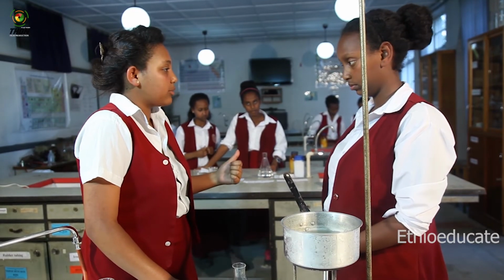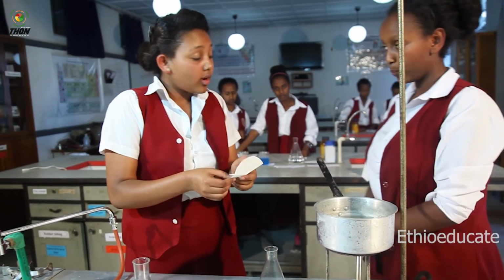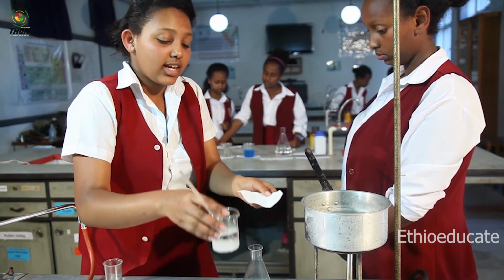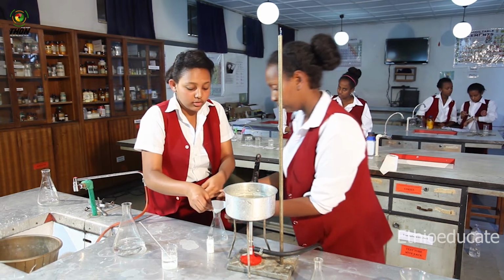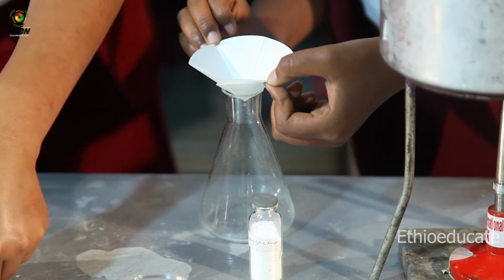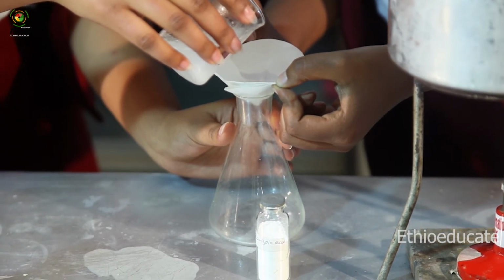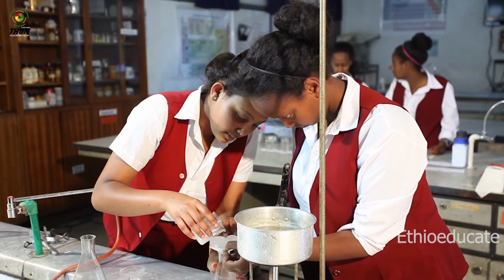Can you please bring me the filter paper, please? Sure. Here, thank you. Now I'm going to use this filter paper to filter this solution, and I'm going to get a pure benzoic acid from the water solvent. Can you hold this for me, please? Sure. I will pour it to the filter paper slowly.